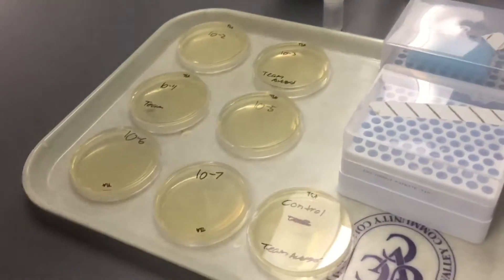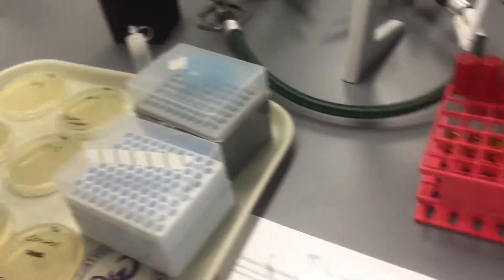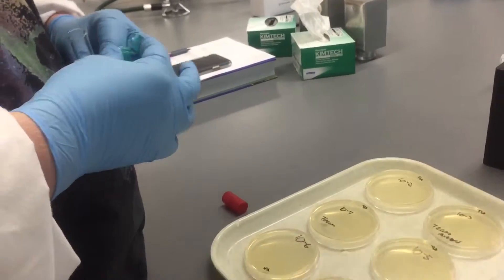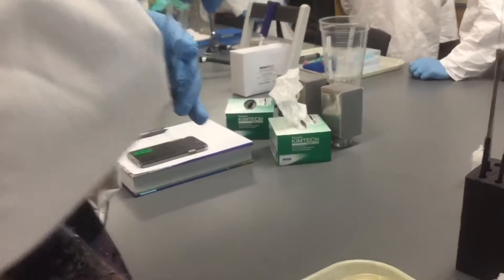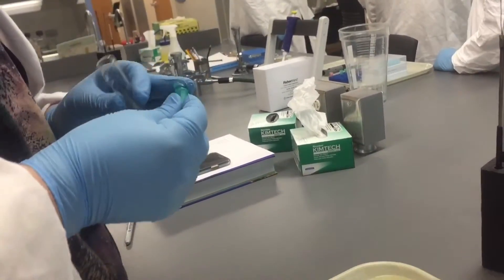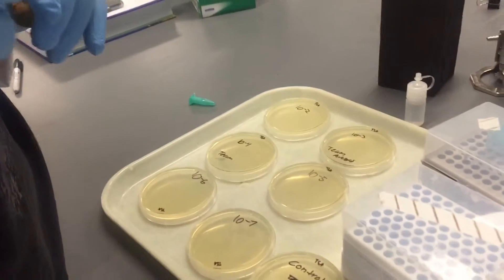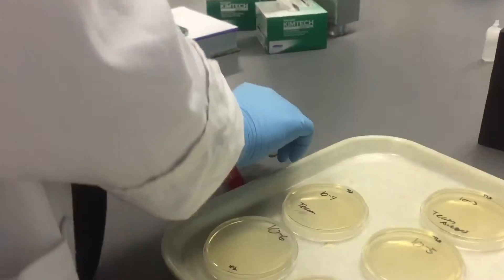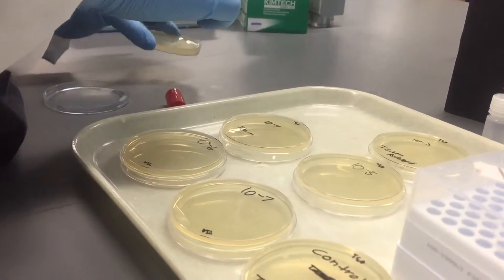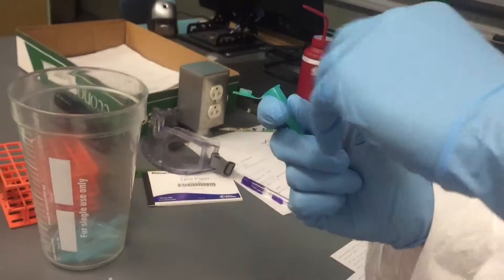Okay guys, we now have four more minutes. Let's wait another minute or two. Everything I put on this is in psychology — yeah, so I like the brain. I think it's supposed to be 400 microliters — but you dumped all of it. Is that 400 micro? There's 300 of the saline and 100 — swirl it around. Number three on its way; make sure it's mixed, swirl it around.